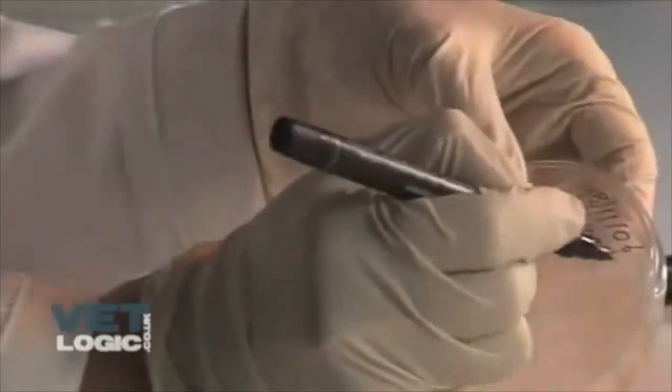Secure the lid with the sellotape. Label the sample with the patient's ID, date and your initials.